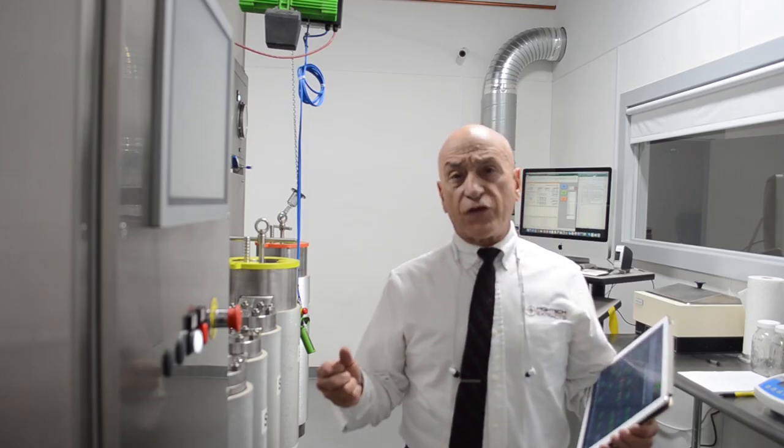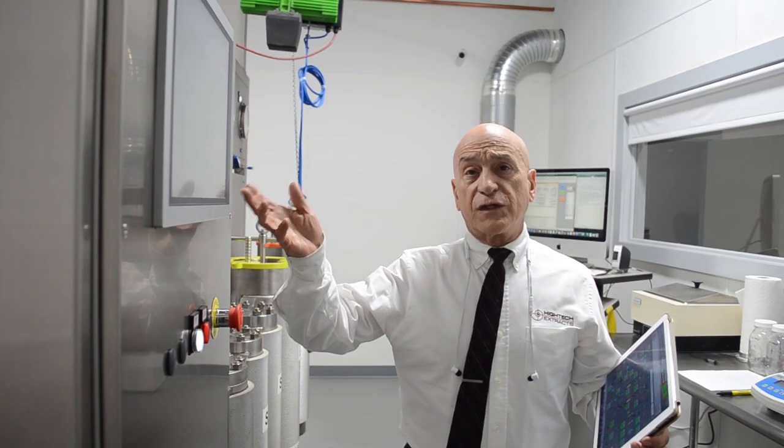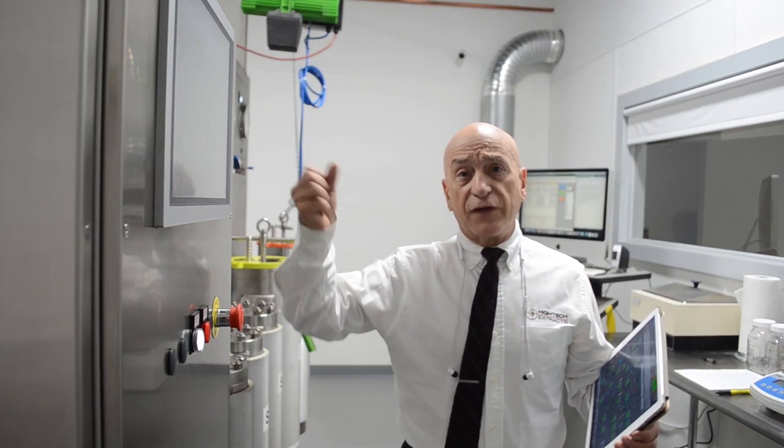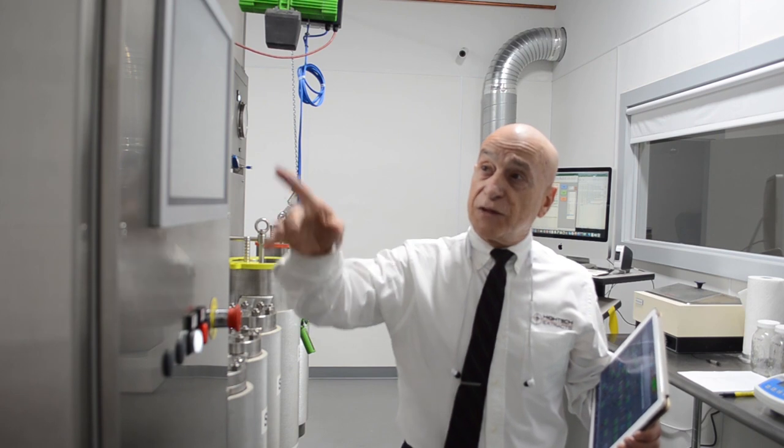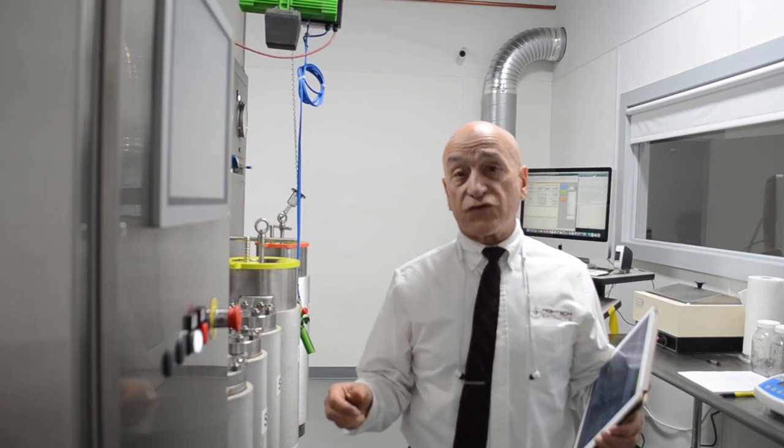So we're back in the extraction lab. The system is building pressure, waiting for set point pressure. It has accepted the change in pressure that I did from my desktop.